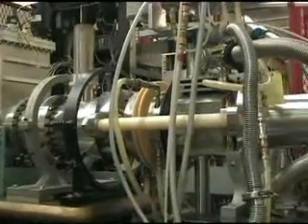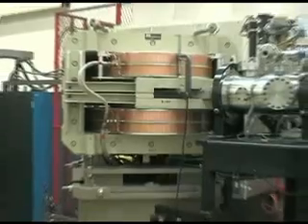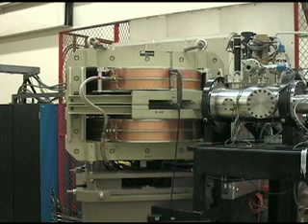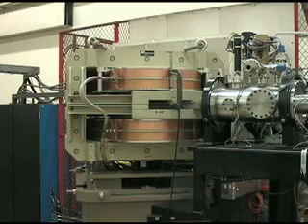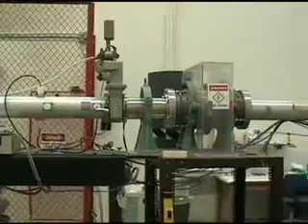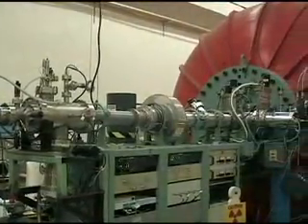To extract the sample, we aim a beam of cesium atoms at the surface of the cathode — you can think of this as a collision process. This is the injector magnet. The injector magnet is used to inject the beam into the accelerator, but it also serves to separate the Beryllium-10 from the Beryllium-9 by bending both beams around a 90-degree corner. These are called Einzel lenses — all they do is catch the diverging beam as it leaves the magnet and focus it back to a point.